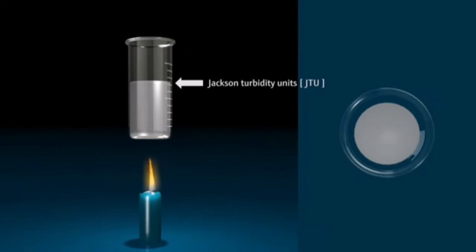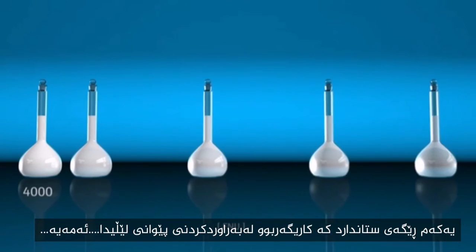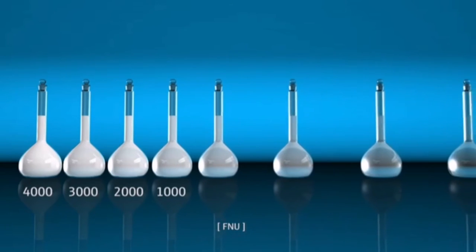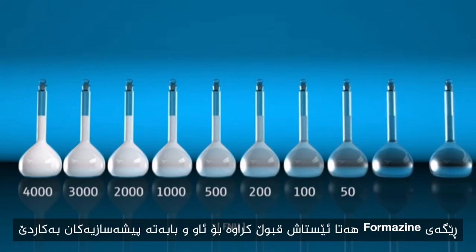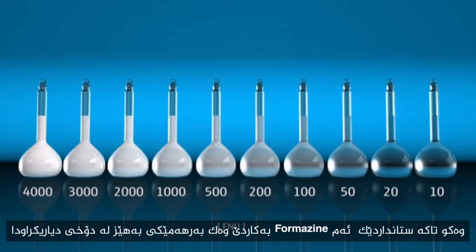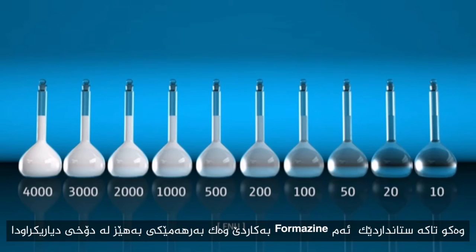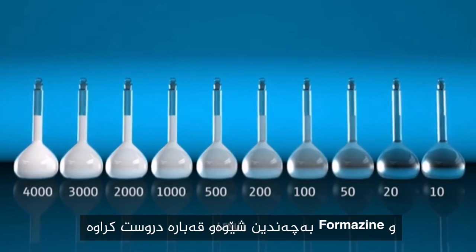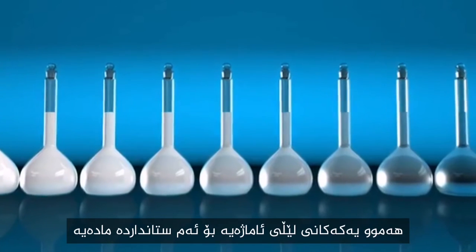The first standard that enabled comparable measurements of turbidity was Formazine, developed in 1926. Formazine is still accepted today across the water and process industries as the leading standard, as it is the only standard that can be produced with high reproducibility under ideal conditions. Formazine forms many different particle shapes and sizes, and all current turbidity units refer to this standard.